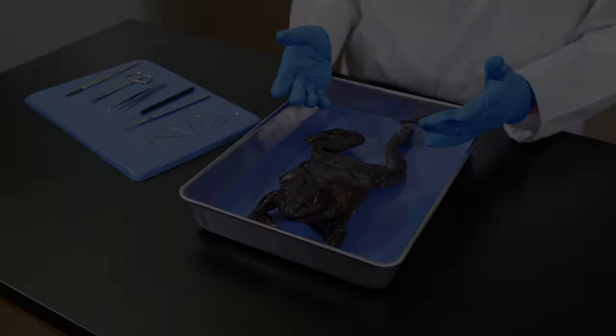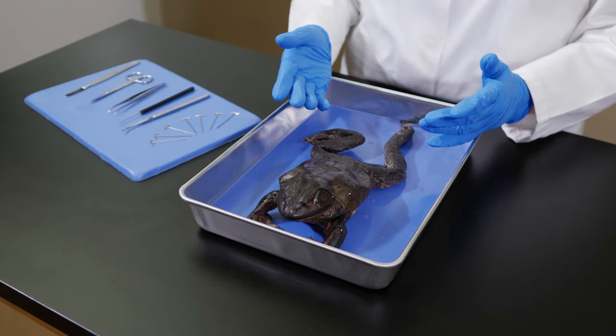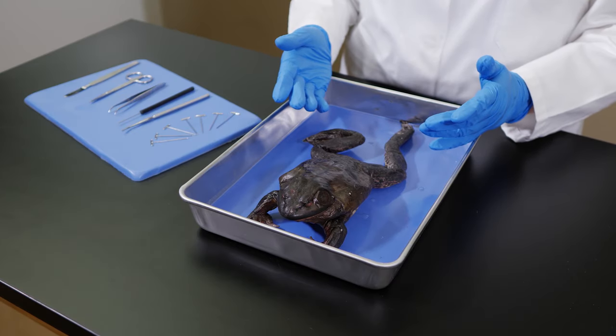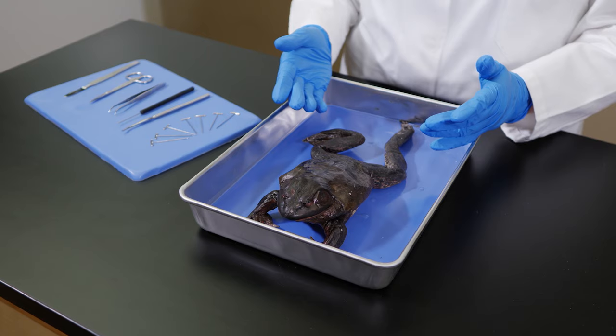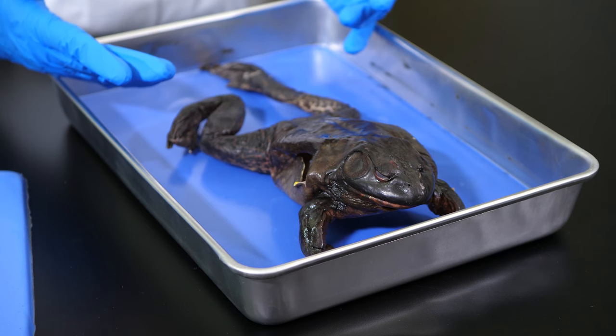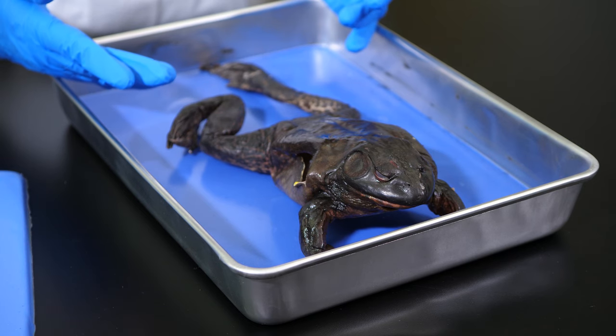In this lab, we will begin the dissection of a frog. We are using a frog for our first dissection because it is relatively easy to work with and its anatomy is easy to see. Our specimen for this lab is a common bullfrog. We will look at its external anatomy and then examine the structures of its mouth.